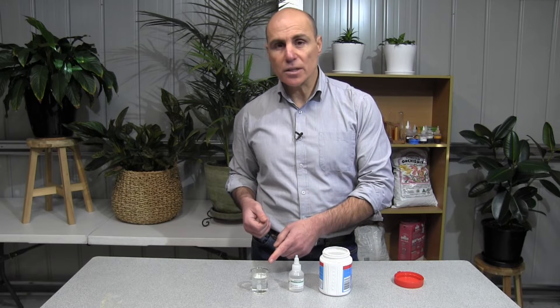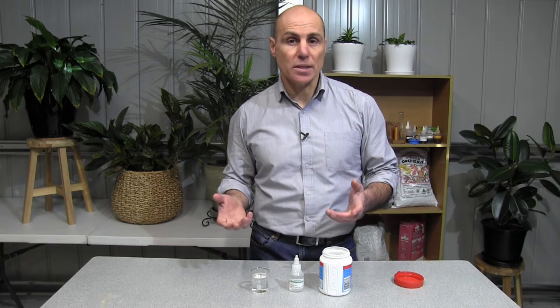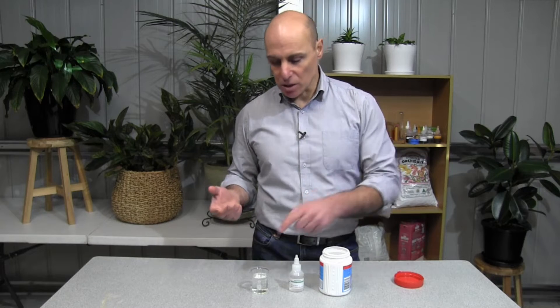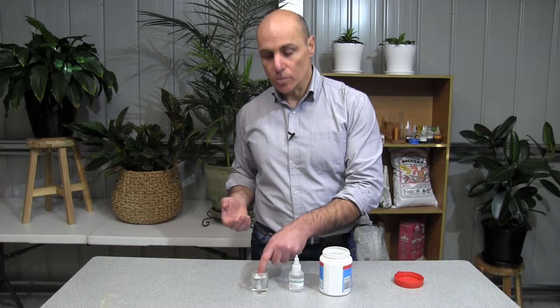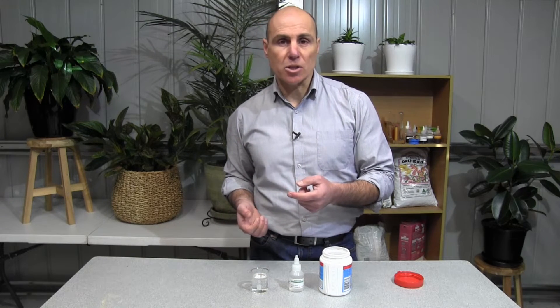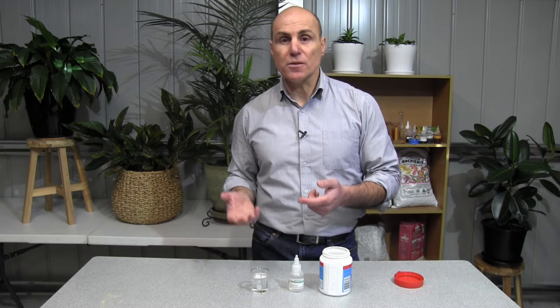The sodium hydroxide in this beaker is heavily watered down, so even if I touch it, which I shouldn't really do, it doesn't really do much damage. But if you do get any on yourself, you should try to wash it off as soon as you can.